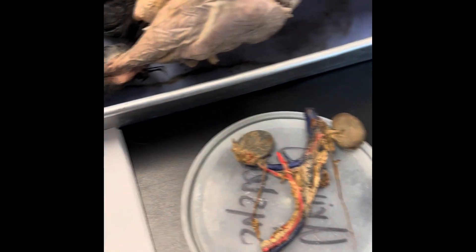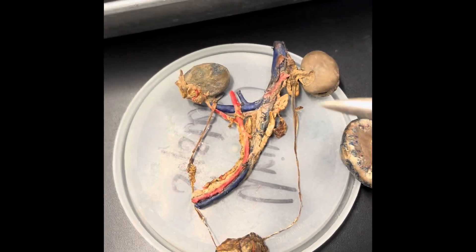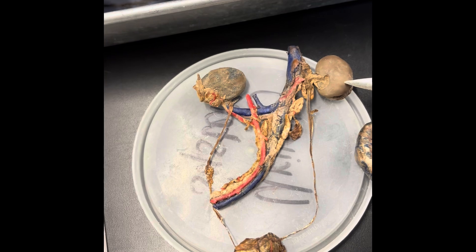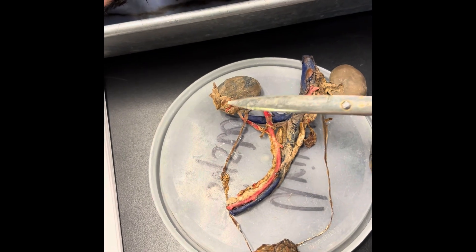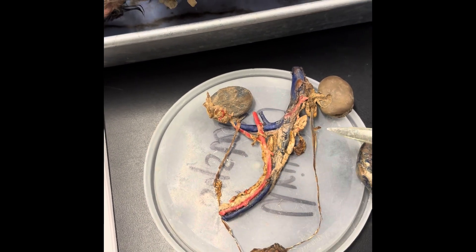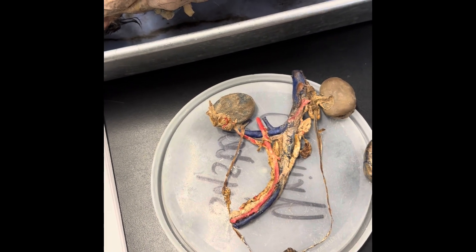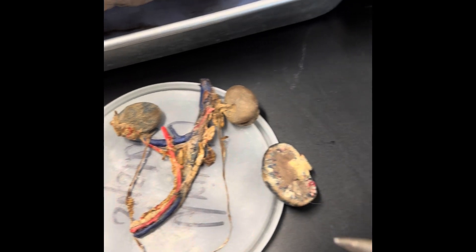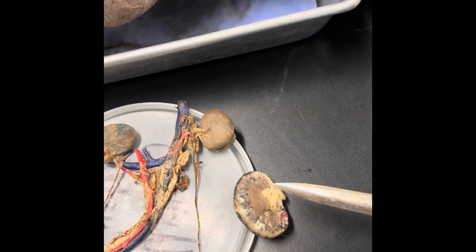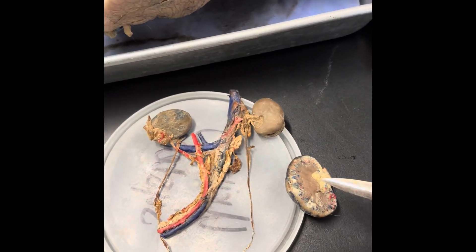Here's another cat kidney. We have two kidneys here and the ureter is coming down to the bladder. And here's the inside of that cat kidney.